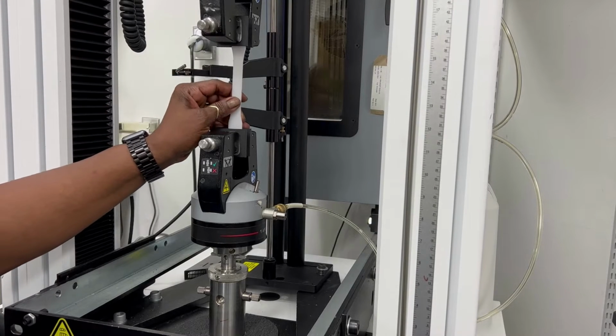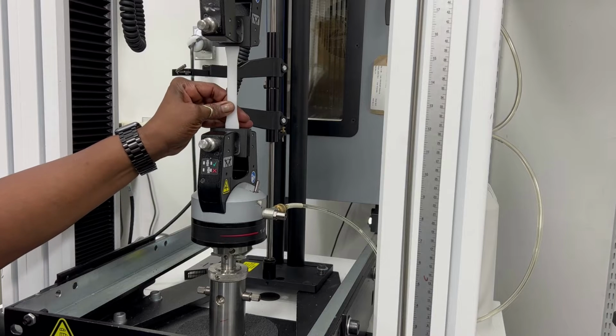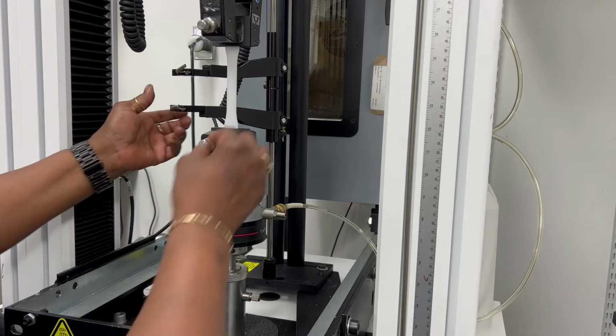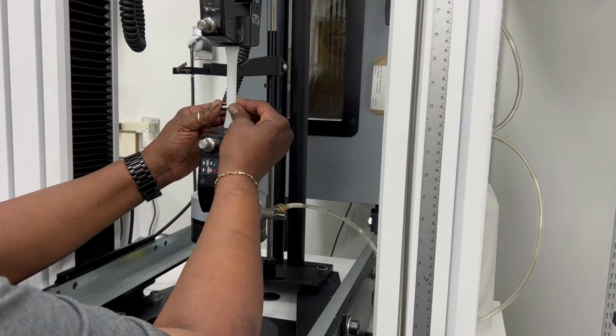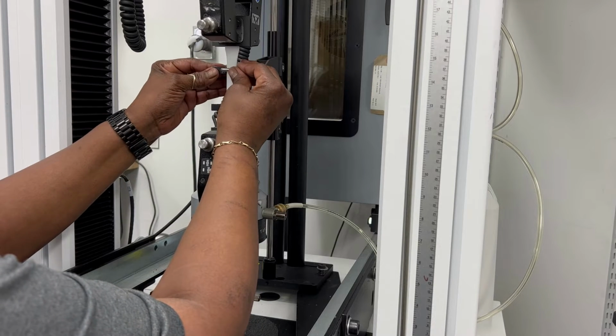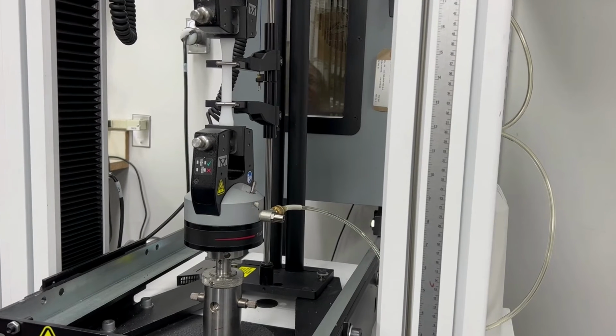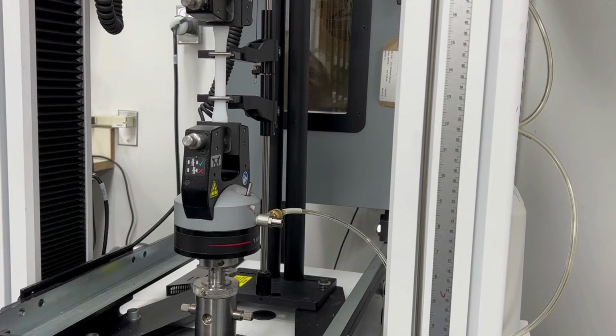The tensile test applies tensile force to a material and measures the specimen's response to stress. It determines how strong a material is and how much it can elongate. It measures the force required to break a composite or plastic specimen and then the extent to which the specimen stretches or elongates to the breaking point.